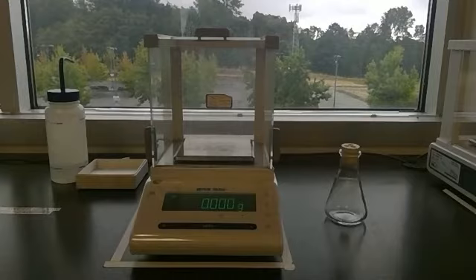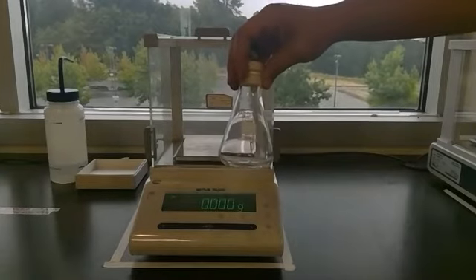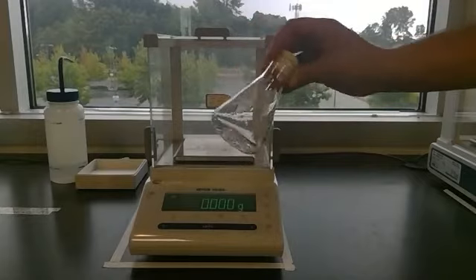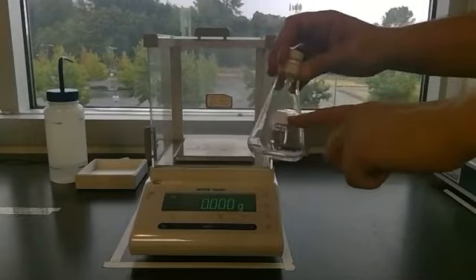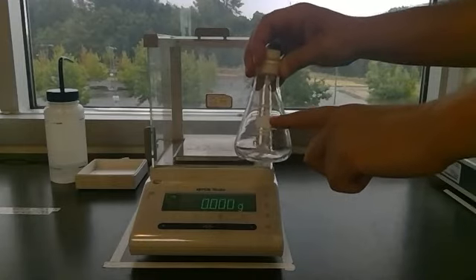In this lab, we're going to be studying the molar volume of a gas, and we'll be looking at the gas contained in a rigid container, this 125 milliliter flask. And to do that, we first really need to know the volume of this. And it's not a 125 milliliter flask in its total volume, even though that's the marking.